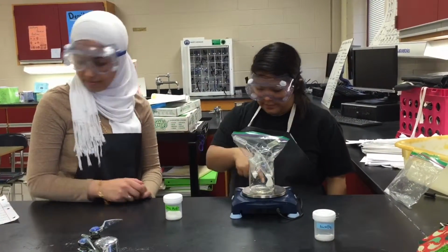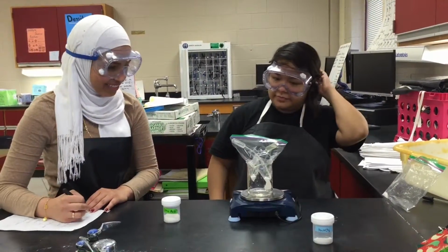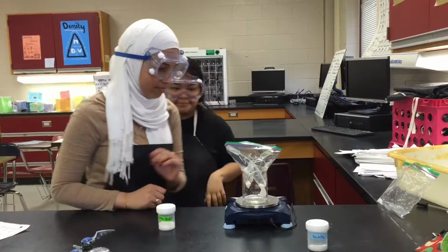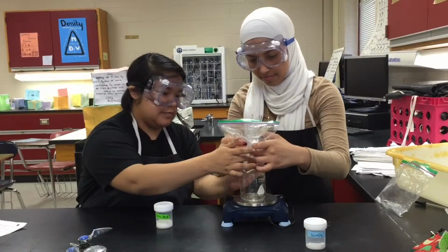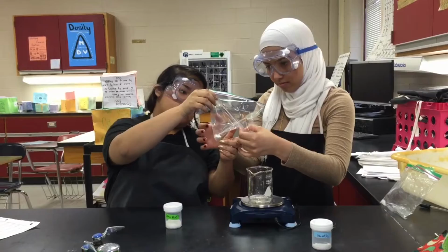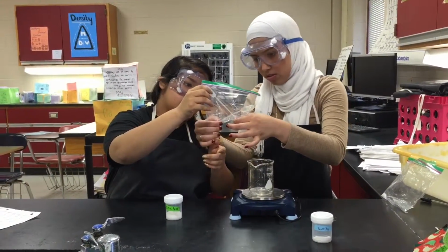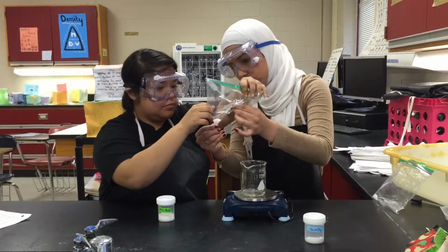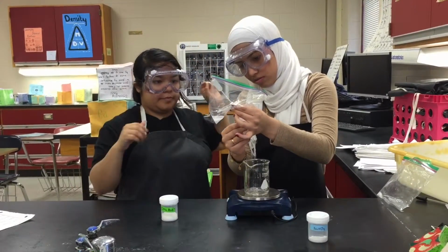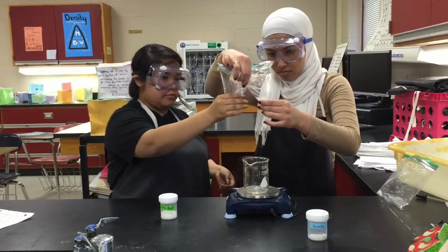Step 6. Remove the baggie from the cup. Lift the baggie from the outside. Gently squeeze the pipettes inside the closed baggie, focusing the stream of water into respective corners to dissolve the solids. Be careful not to suction chemicals into the pipette. Step 7. Mix the substances together in the baggie by rocking or squeezing it gently.